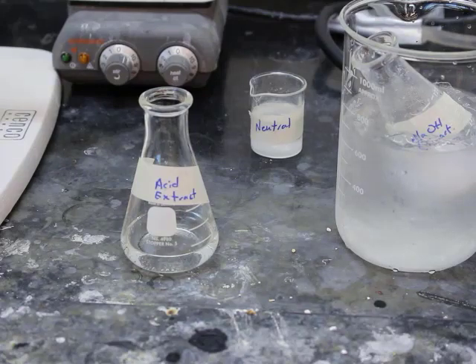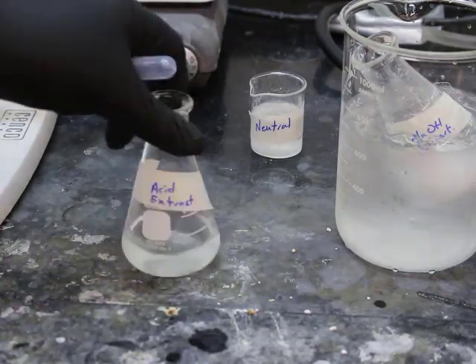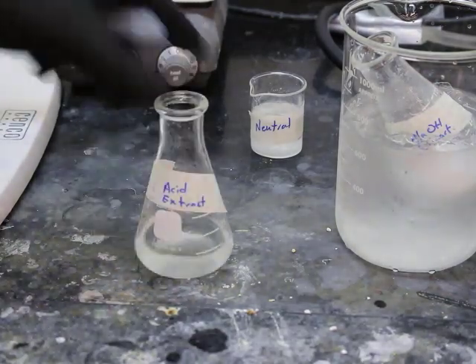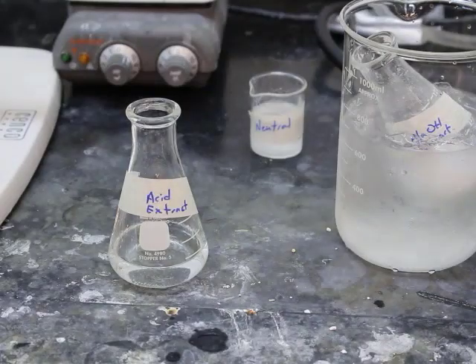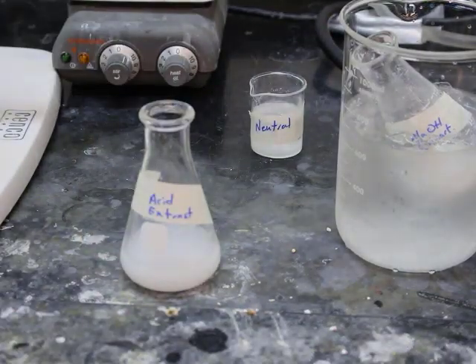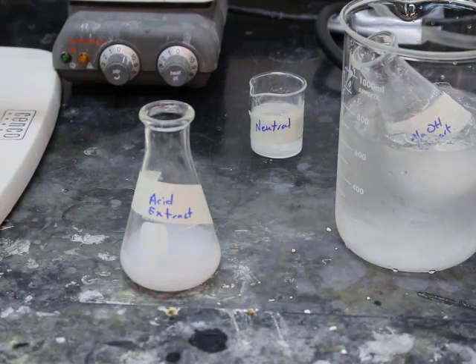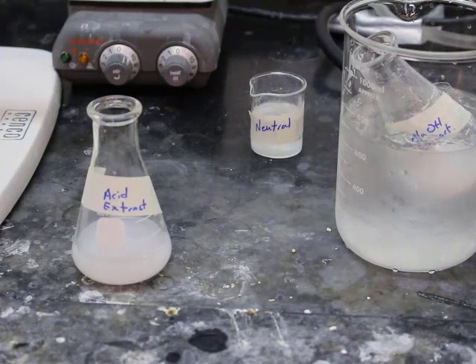And so now with the acid extract, we are going to add base, specifically 6 molar sodium hydroxide. And if you notice, with each addition of sodium hydroxide, we see a white solid. All right, pH tested, it was still acidic. So then added some more sodium hydroxide. Now you see all that white cloudy stuff. So yet again, pH tested it. That indigo color tells us that yes, it is a basic pH.